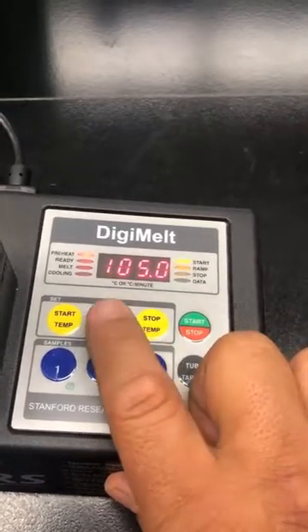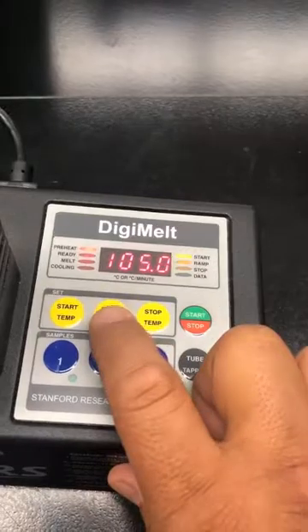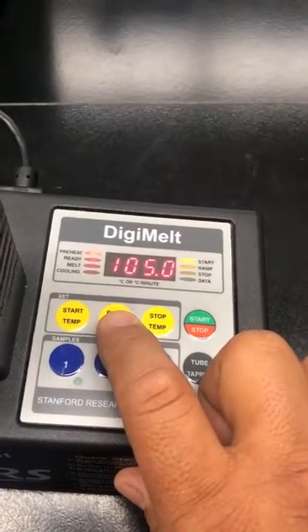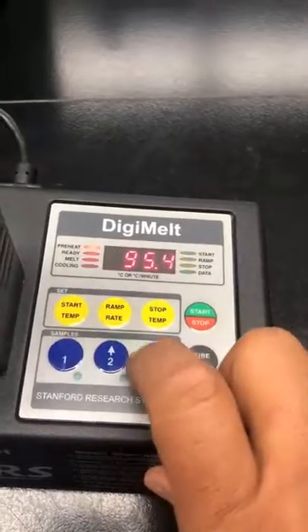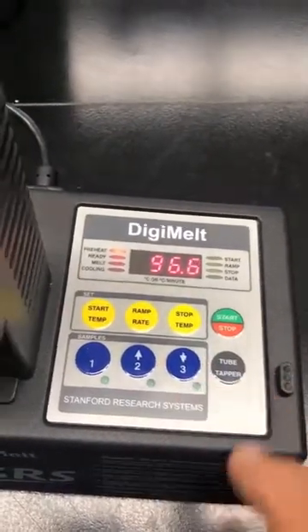But having said that, I know this is toluene, so I'm starting a few degrees below. A ramp rate of 2 degrees a minute is probably sufficient. I've got this thing warming up, and when it's ready I'll start running it.